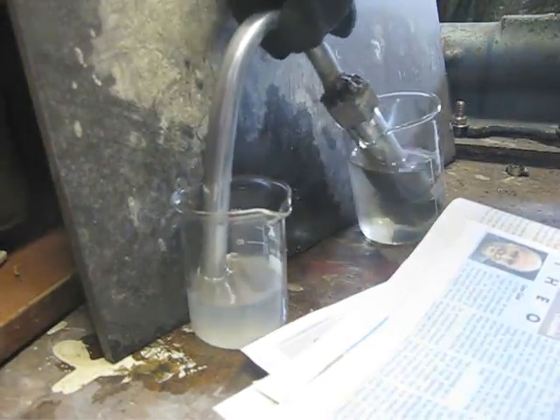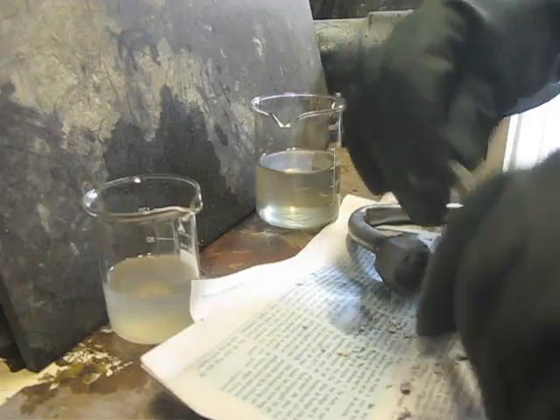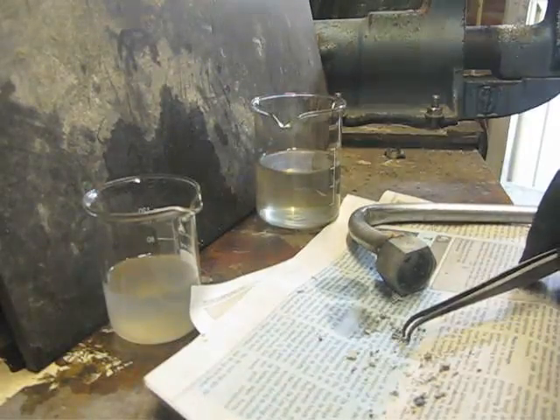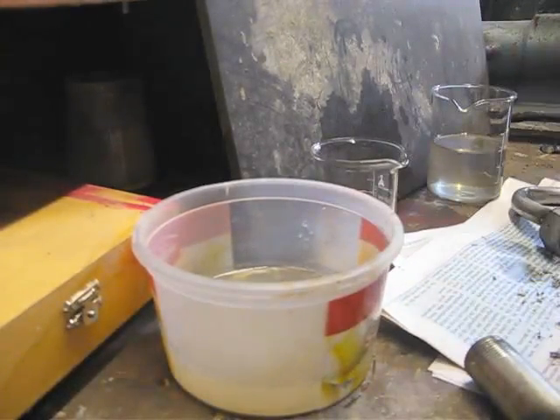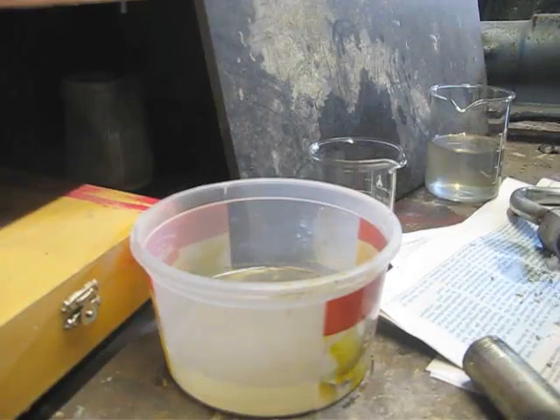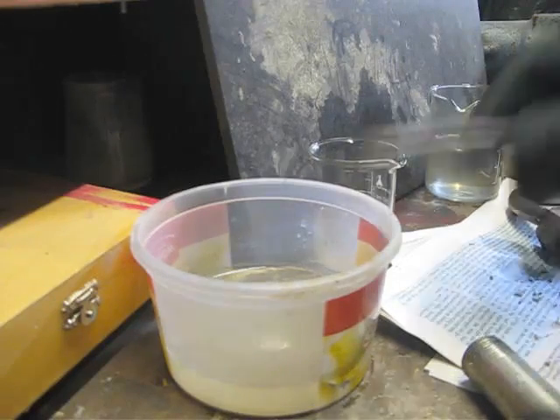Now I'm going to open up the container. I'm going to put some water here and try it out. I don't think there's much potassium metal present — you see some reaction anyway.